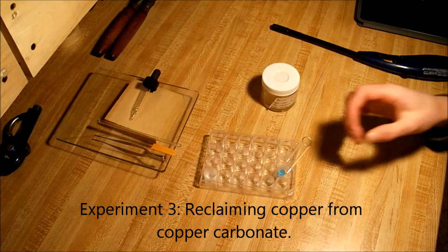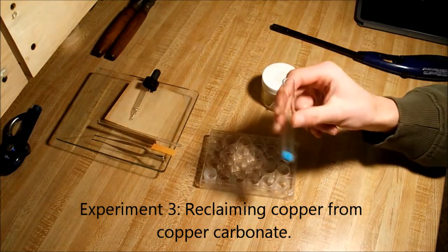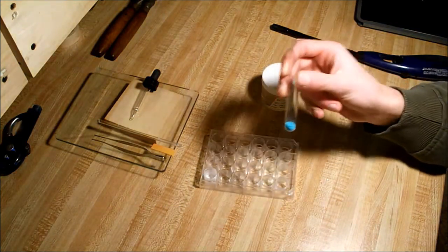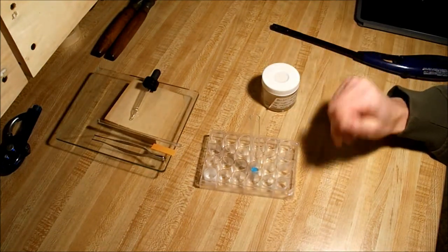Alright, our last experiment today is turning copper carbonate, this blue substance here, into copper metal. This is kind of a double experiment, but it's fun to do anyway.